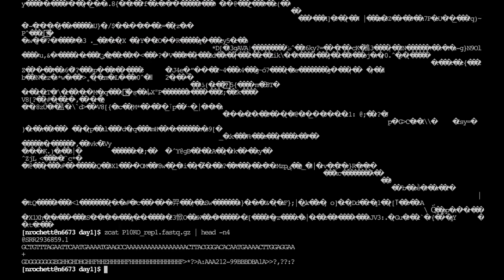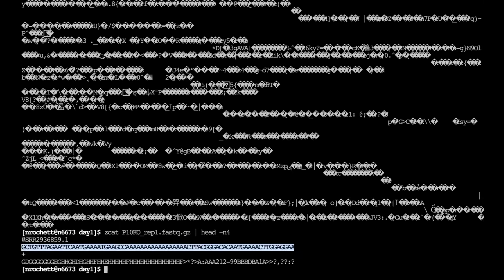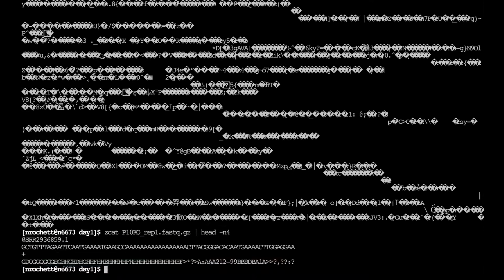And we can do it like this. We decompress the file, and then we head. So head is going to see the decompressed file. Then we can take the first 4 lines, which, because this is a FASTQ file, is going to be the first read. So we have the ID of the read, then the sequence, and then the qualities. But you really have to decompress the file because it's gzip.